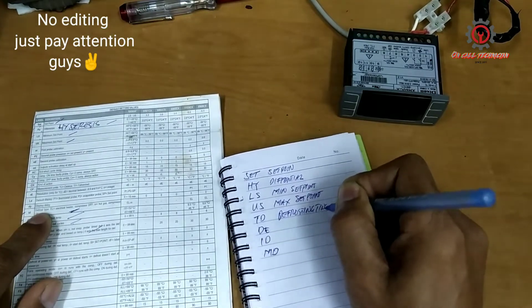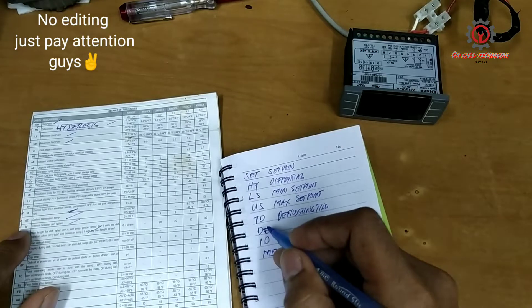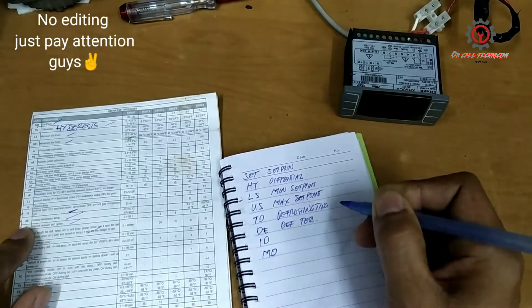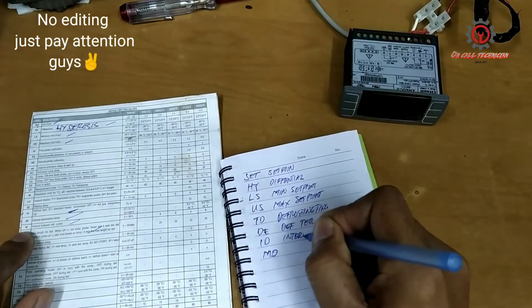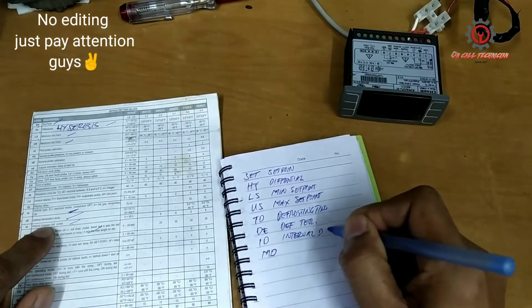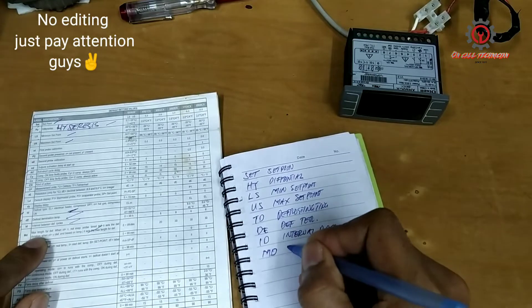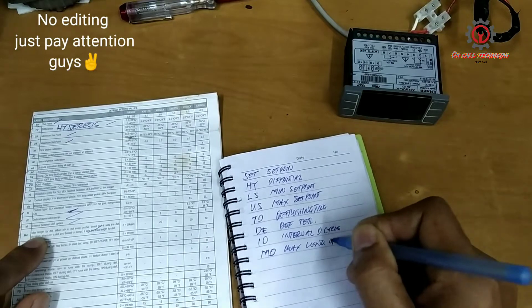Defrosting type is either EL or hot gas. DE is defrost termination, ID is the interval between defrost cycles, and MD is the max length of defrost.